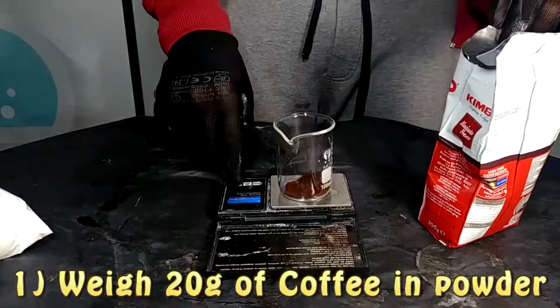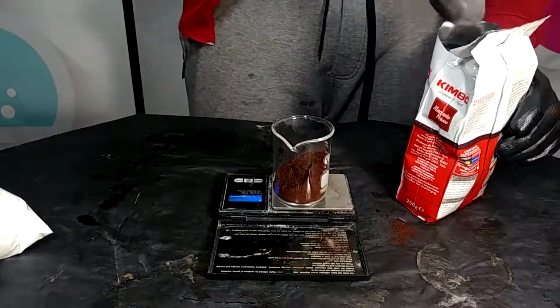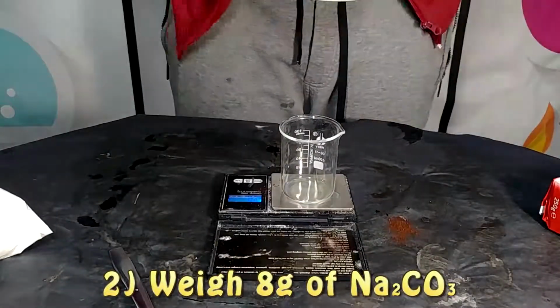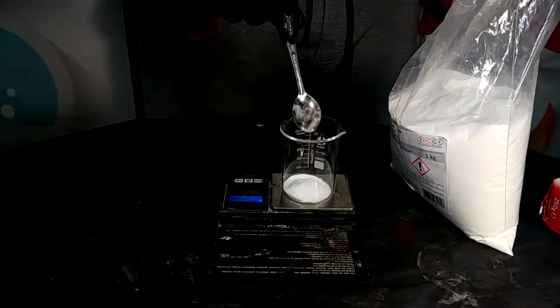The first step for our experiment is to weigh 20 grams of coffee in powder, of course. Then we're going to add it to a beaker. After that we're going to weigh 8 grams of sodium carbonate, and also we're going to mix it with our coffee.